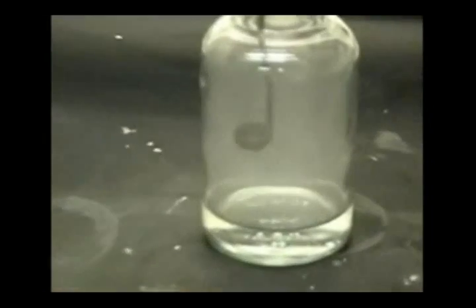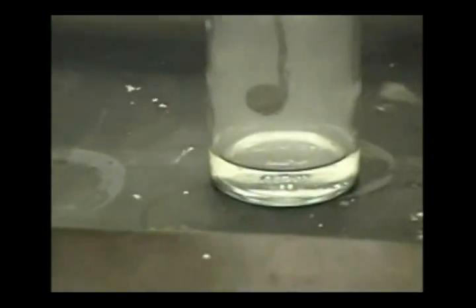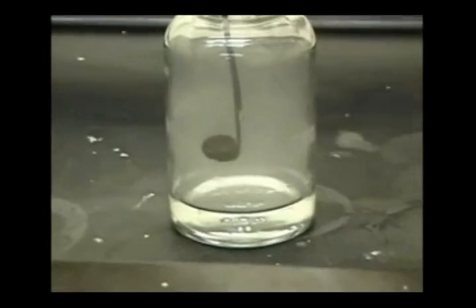As you can see, an abundance of SO2 gas is being produced in the glass bottle.